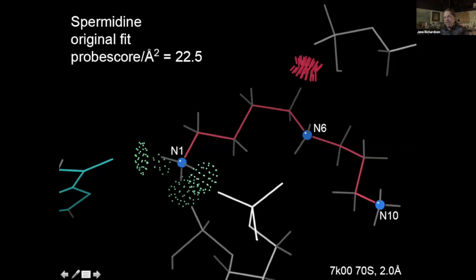So this was in a wonderful recent cryo-EM structure of the E. coli ribosome at 2 angstrom resolution. And most of the structure is gorgeous, but spermidines are hard. And so they got a bunch of them wrong, and they aren't that important for the structure. They're not the thing people look at the most, but we're interested in them as a test of how well you can fit difficult ligands. And so here, there's this huge clash at this atom, and there's nothing hydrogen bonding to the N6 nitrogen. And so if you turn it over and put N10 where N1 was and N1 where N10 was, then you shift the N6 over by one atom, and now it makes a great pair of hydrogen bonds to a phosphate and gets a way better score.